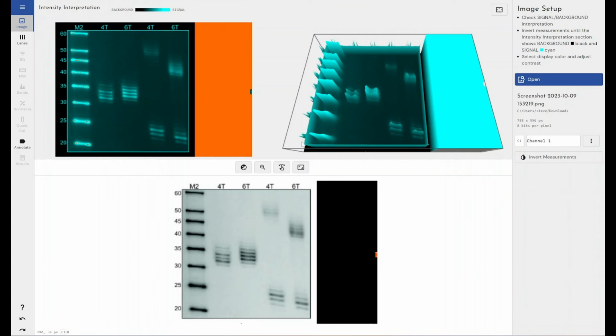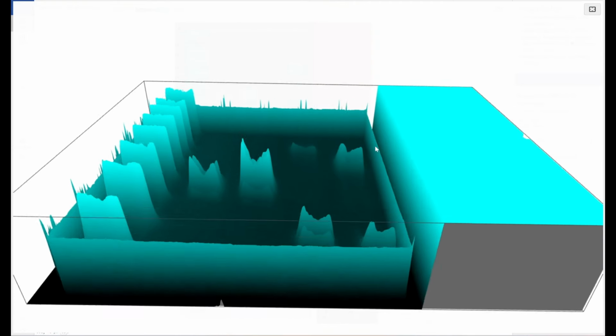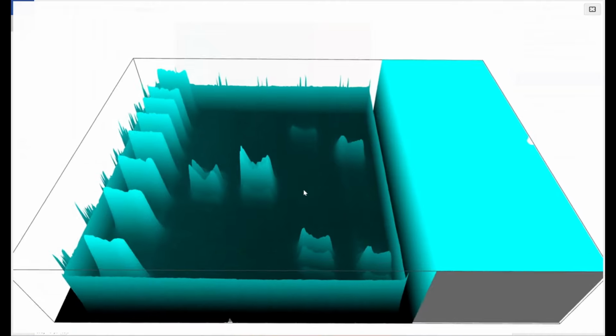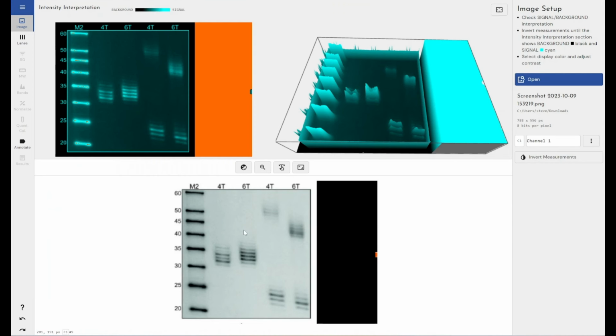So that's highlighted by default. I'll have a look at my image here in the 3D view, and I can see that I'm seeing my bands represented by lovely peaks rather than troughs. So I don't need to invert this image. So I can just go ahead with my analysis.